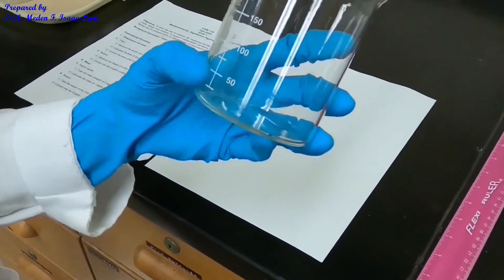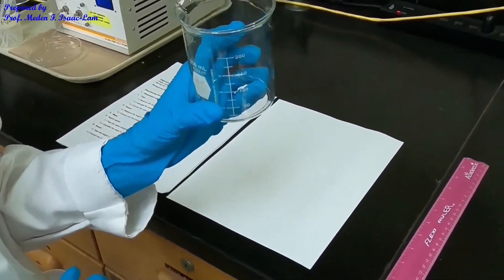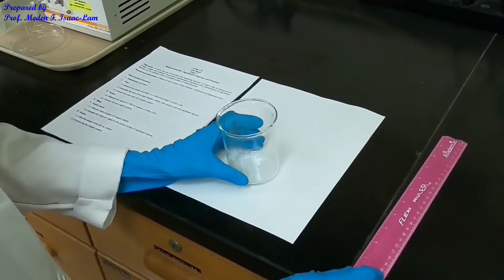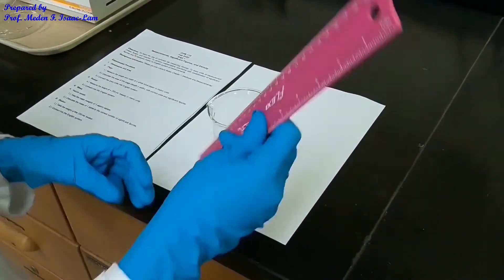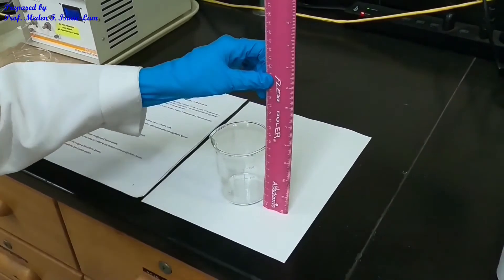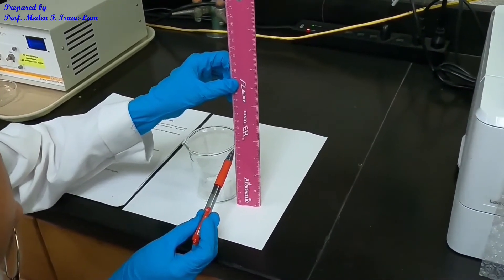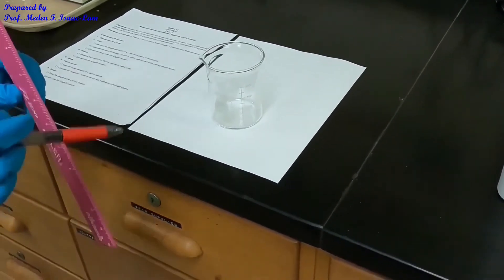Part B is about the beaker — a glassware used to measure the volume of a liquid. We are going to measure the height of the 250 ml beaker in metric units using the ruler in centimeters. Reading it, it's between 9 and 9.1, so I say it's 9.08. You are going to convert this again into the English system.